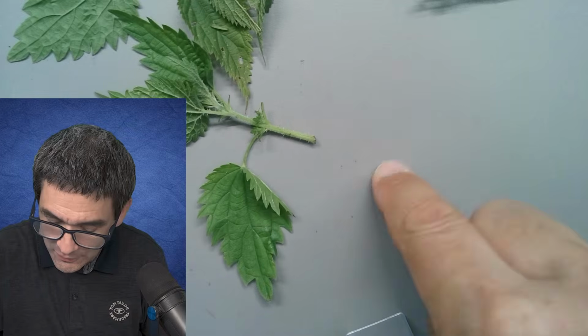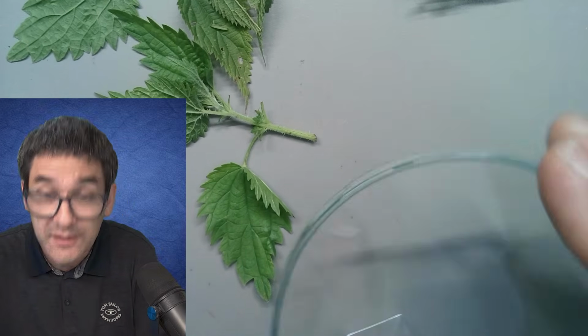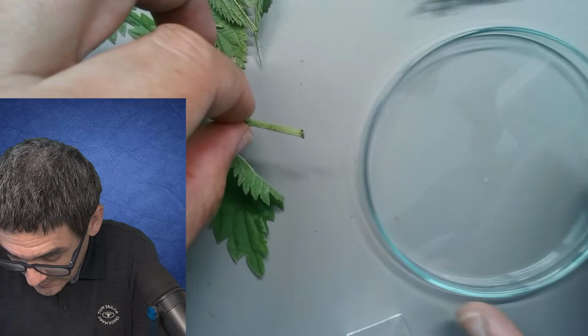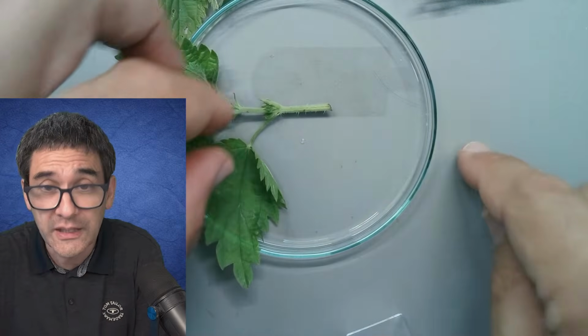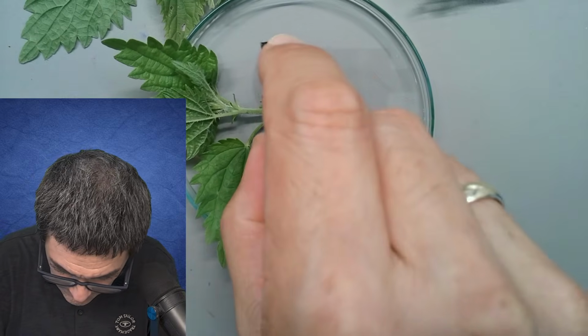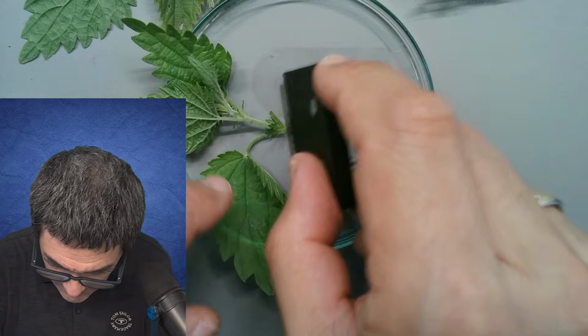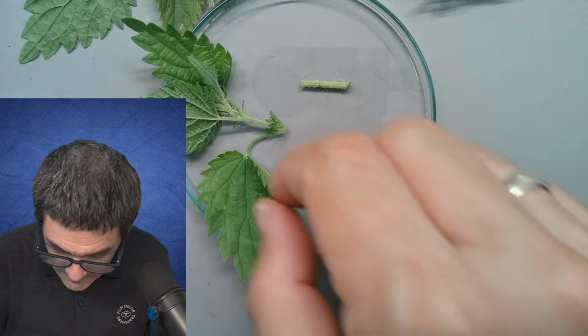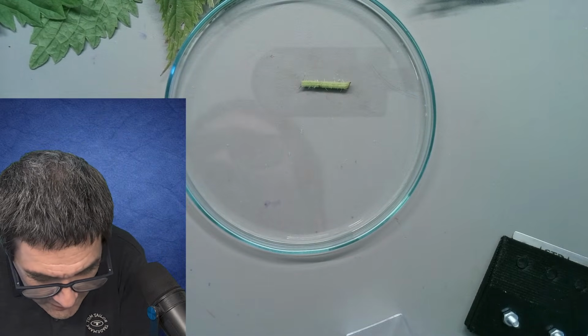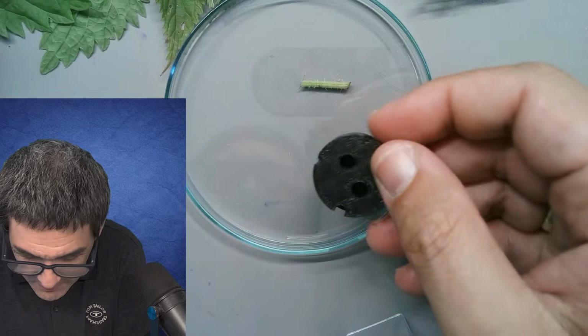So what I'm going to do now is I need a solid surface, because the surface that I have here is actually a soft plastic writing surface to protect the table and to give it a nicer background color. But this also means that I cannot cut anything on here. So I'm going to do it like this. Okay, here we go. Let's remove this here, and I need to put this now into one of those specimen holders.